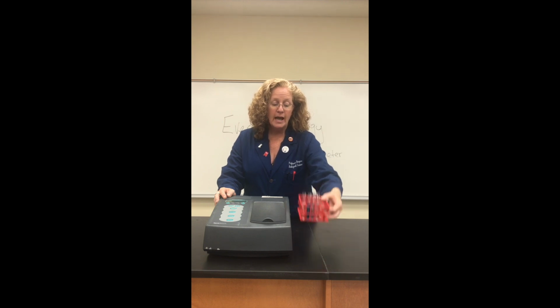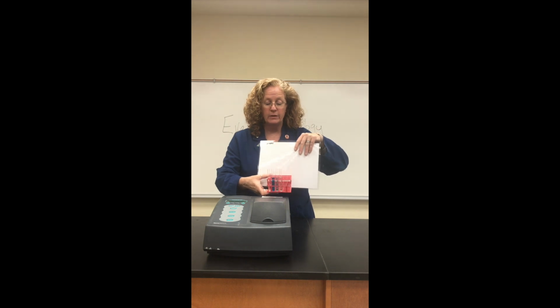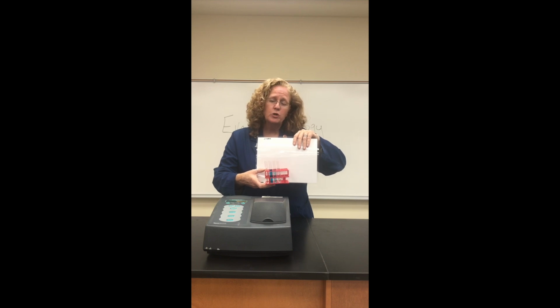Now, looking at these three different concentrations, if we put some white behind it might make a little more sense. You can see there are, of course, different colors and different intensities of blue. We can measure that and say on a scale of 1 to 10, the first tube is a 10, the second tube is a 5, and the third tube is a 2. This is known as qualitative data, where we don't have an exact measurement, we're just kind of taking a look at it and making a guess. We're scoring it or grading it.